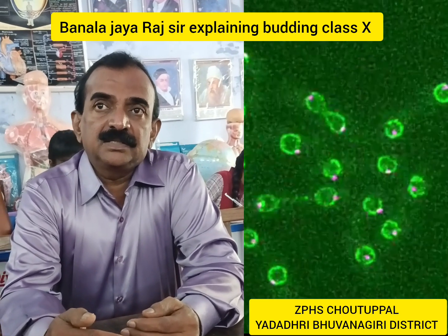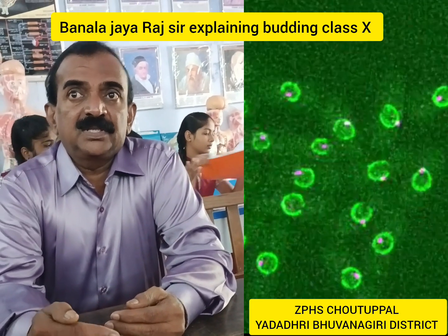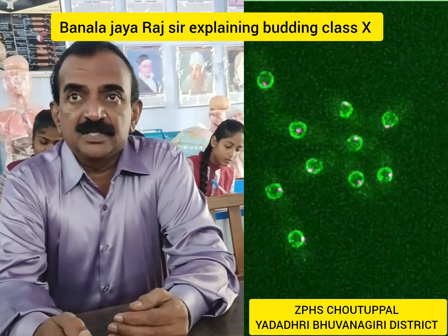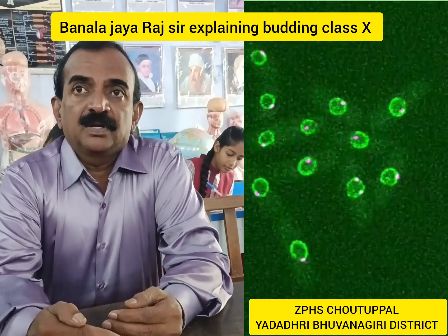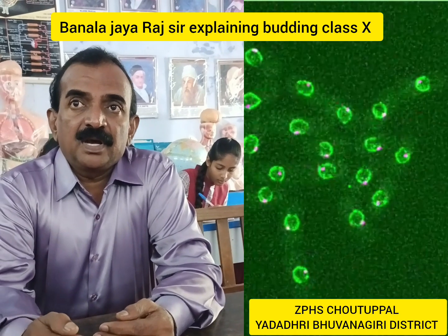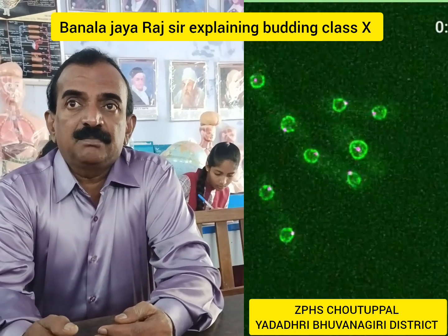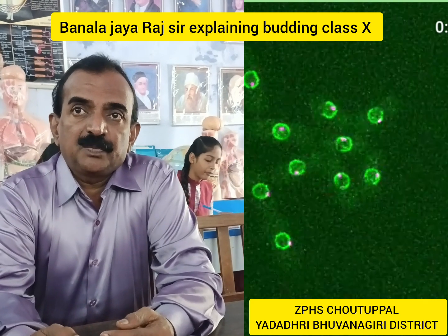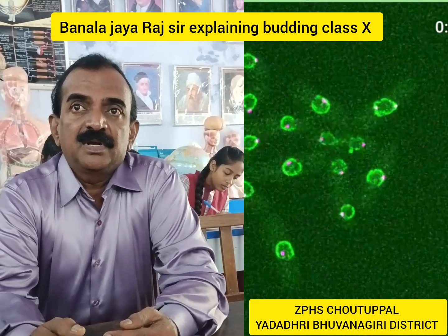Budding is an asexual process of reproduction that we observe in yeast cells. We are observing the clear division of yeast cells by formation of buds. Asexual reproduction in yeast cells is by means of budding.